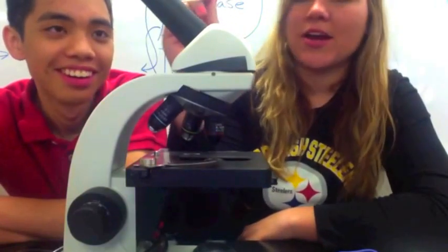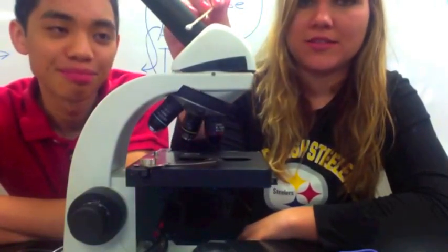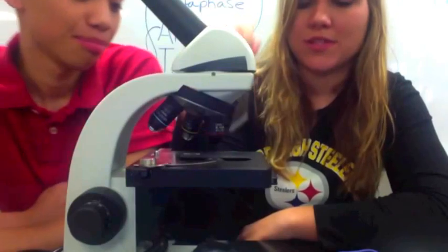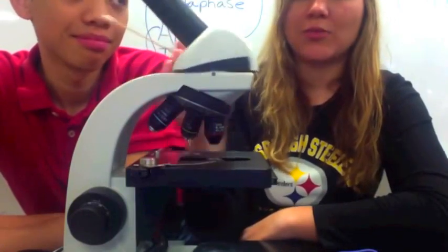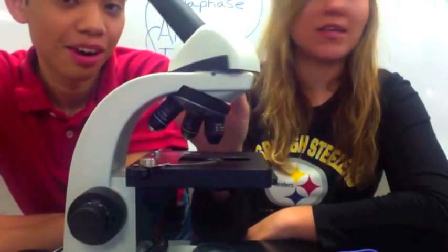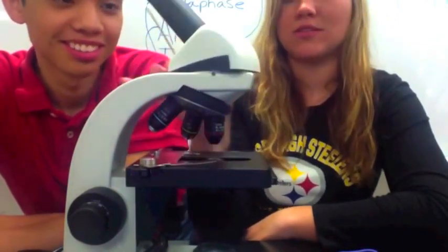This part right here is called the ocular lens. This is the part that you look through to see the specimen on your microscope. This part is called the head, and the way you can remember this is that just like the head on your body rotates, this rotates as well.